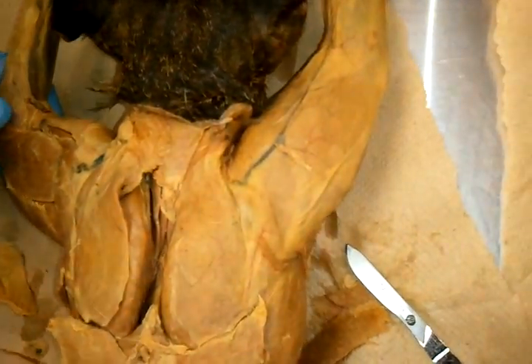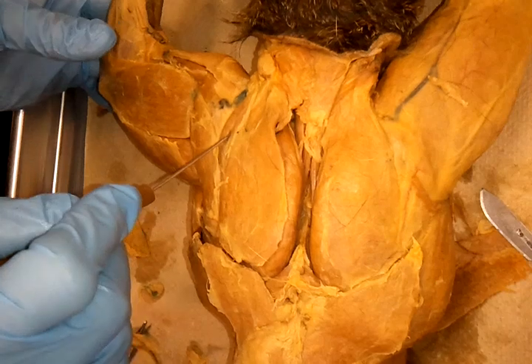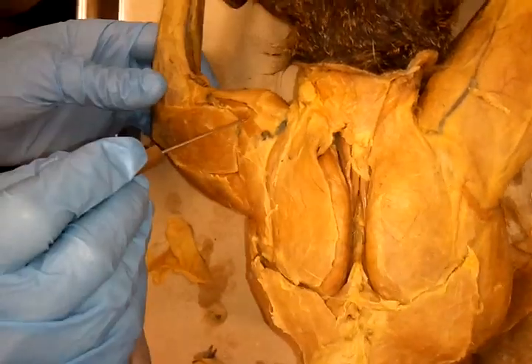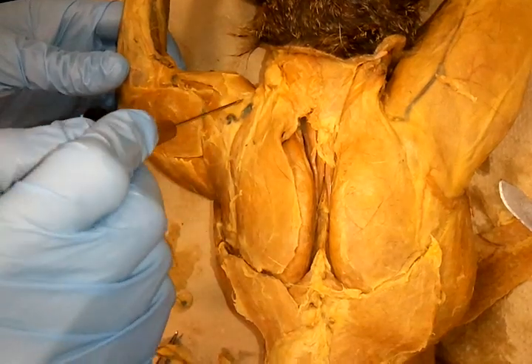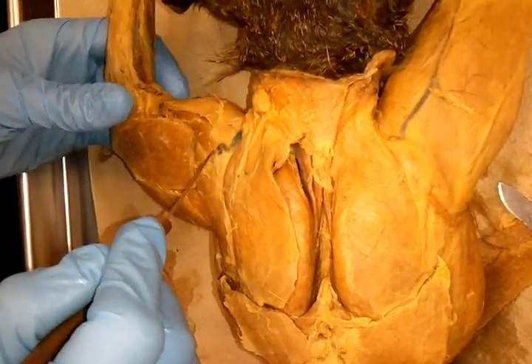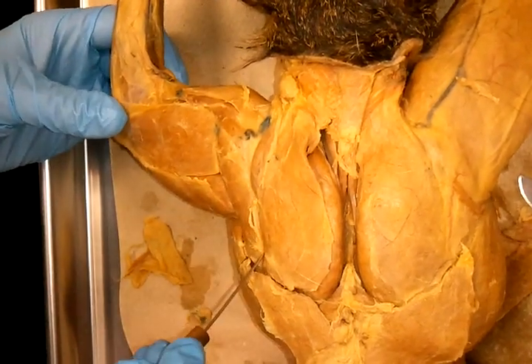This little strap here — levator scapulae ventralis. And then you have the deltoid group. We have one deltoid; they have it in two, three parts. The one here most superior is your clavodeltoid. And then this part here is your acromial deltoid. And then you have this other strap here, spinal deltoid.